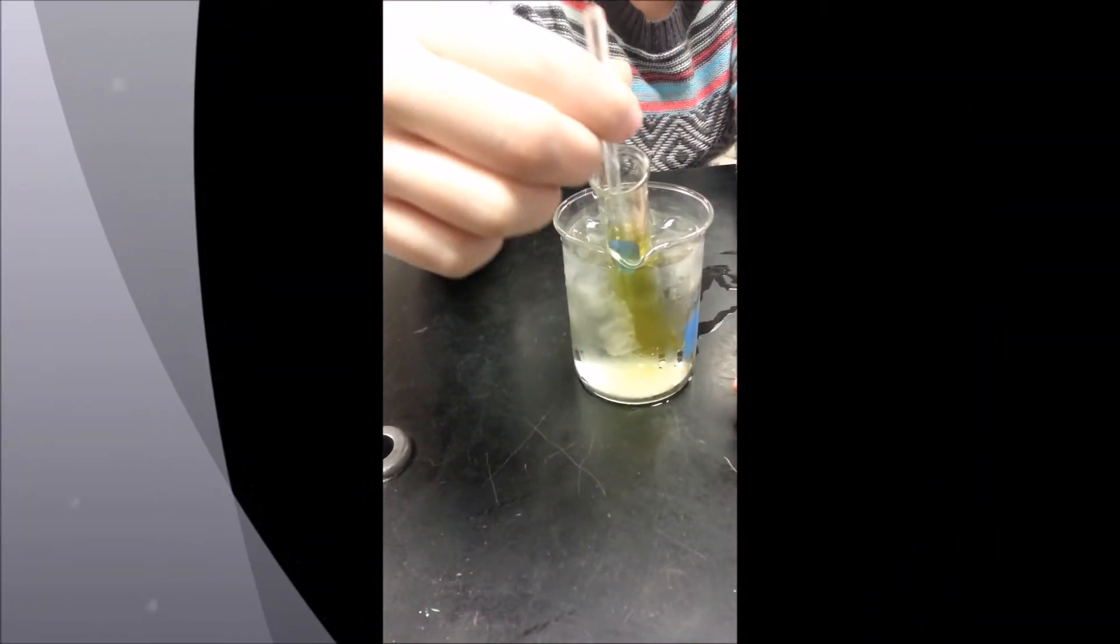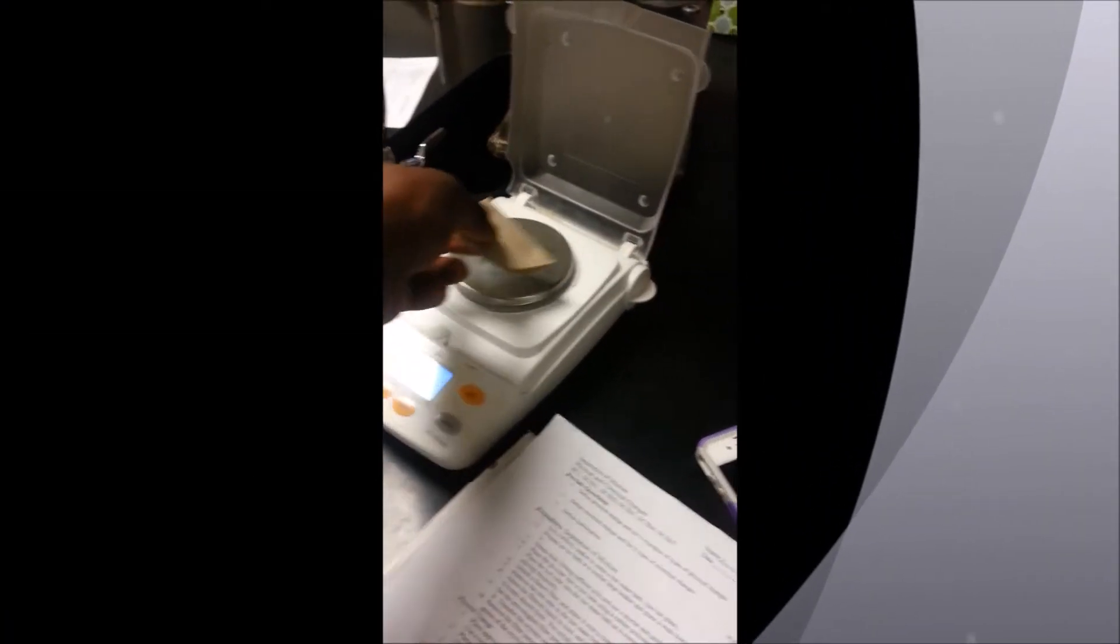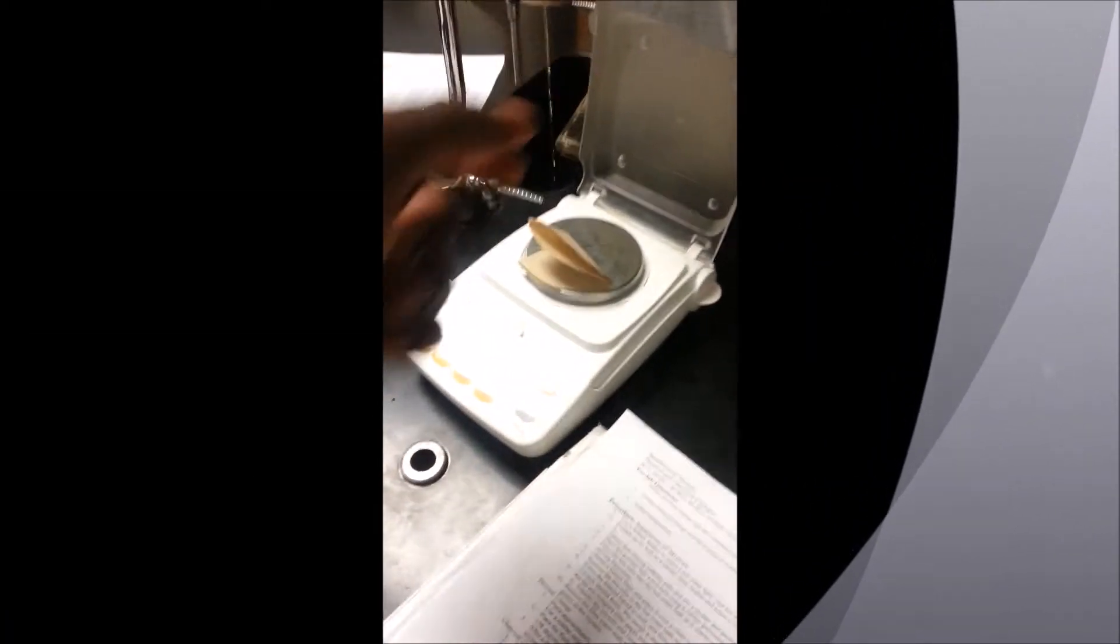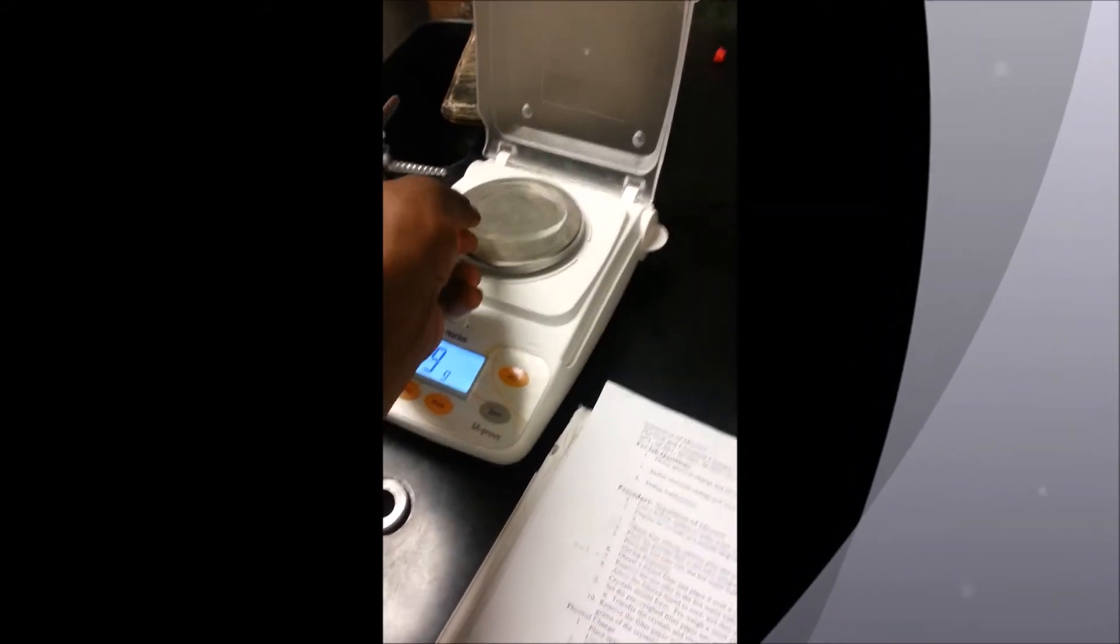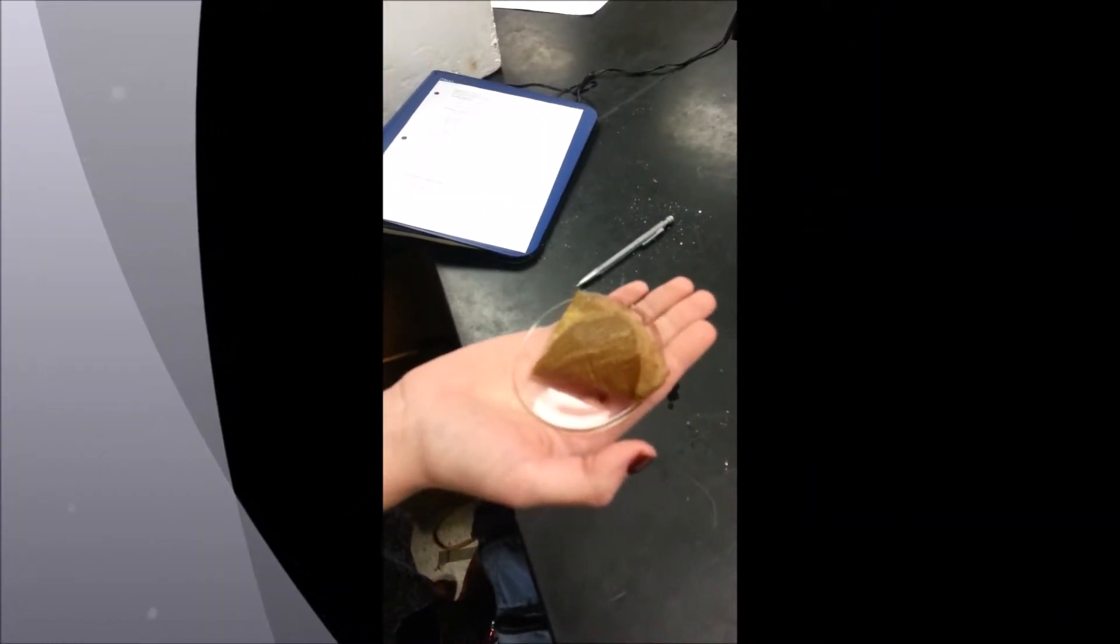Place your liquid into an ice water bath until crystals have formed. Measure a piece of filter paper and a watch glass. Filter your crystals and place them onto the watch glass.